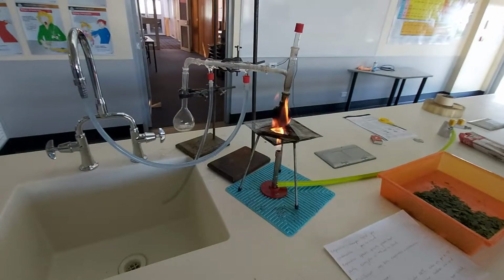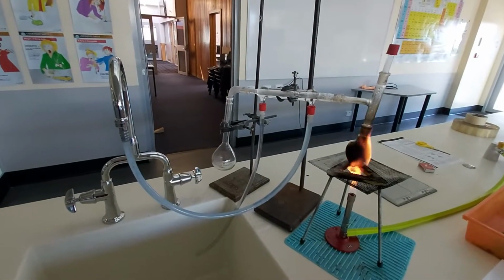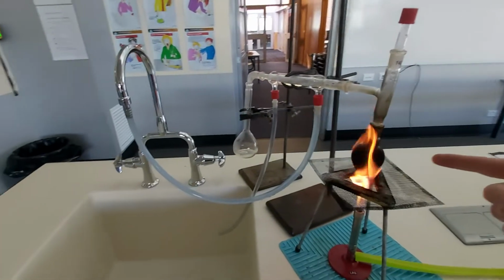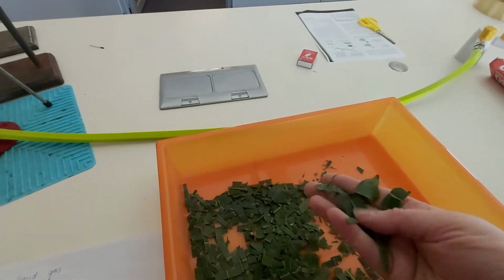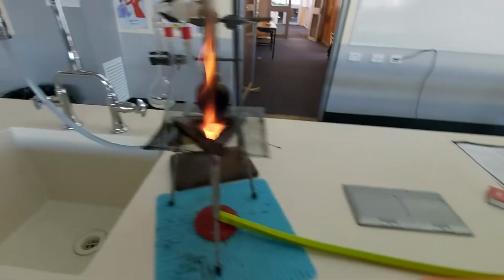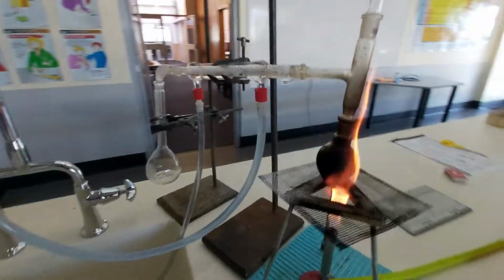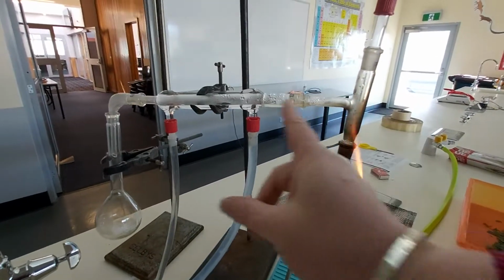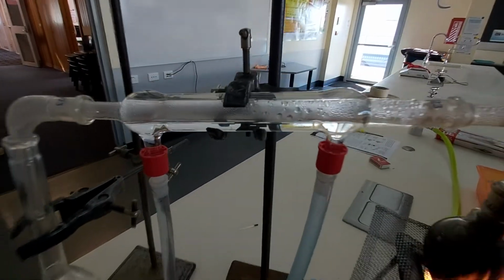Today we've got the Liebig condenser, which is what you saw a diagram of in your notes this week. So what's going on here is in this little flask just here, I've got chopped up gum leaves. We're going to try and distill or make some eucalyptus oil, and I've put that with water into this little container. What happens then is that with the heat, that water evaporates and comes up here. The only place for it to go is along here, and you can see the condensation there.